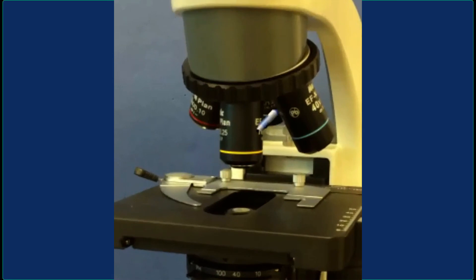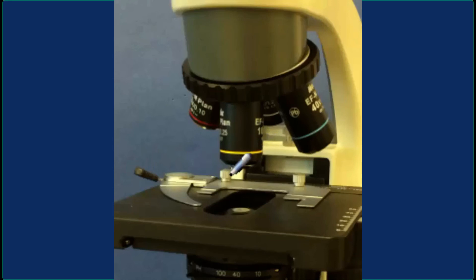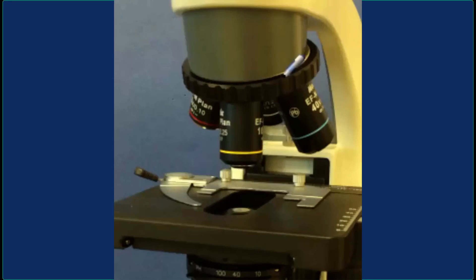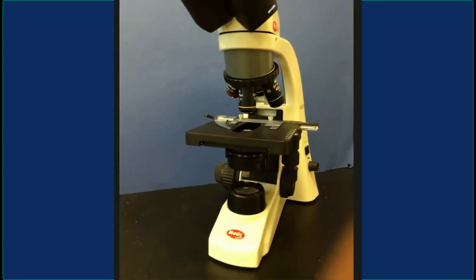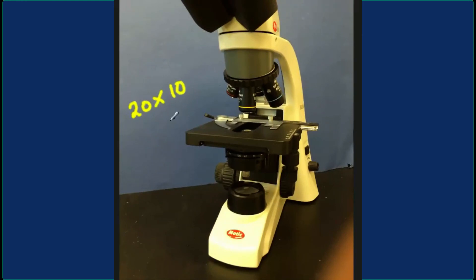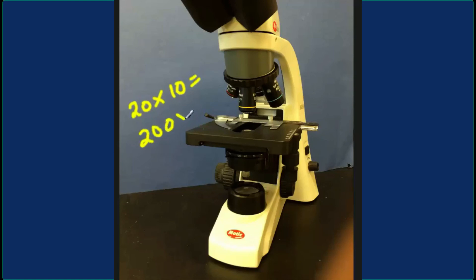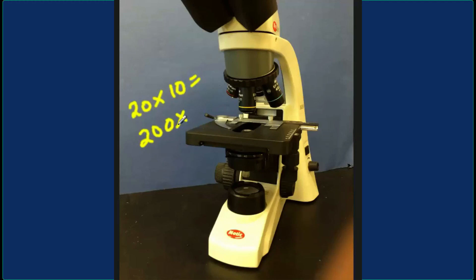Here is the scope with the 20x objective in position — you can see it has the yellow line. When you take the 20x objective and multiply it by the 10x from the oculars, you get 20 times 10, which gives you a magnification of 200 times. So you've increased your magnification by a factor of 5 by going from the scanning to the 20x objective.